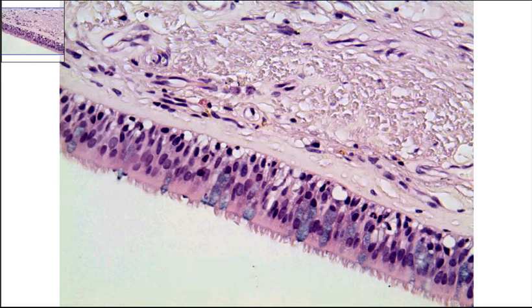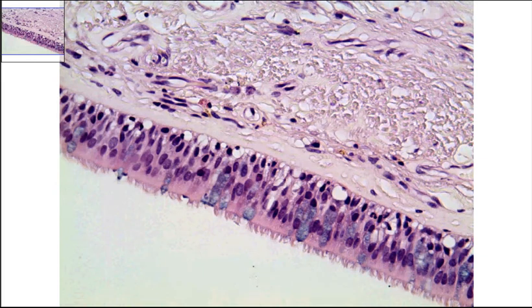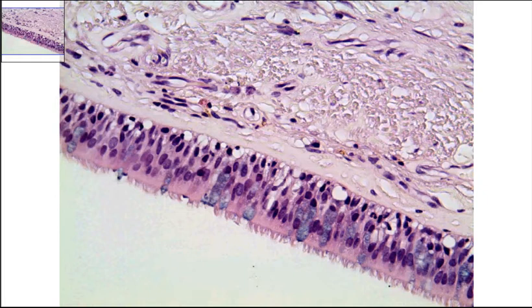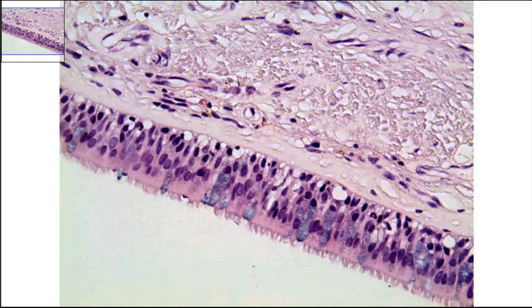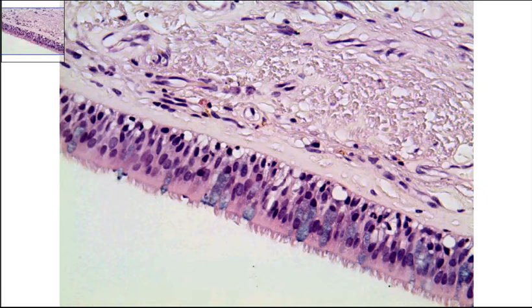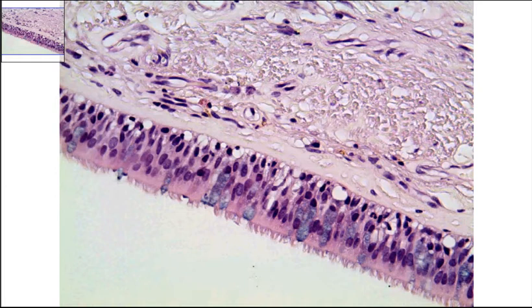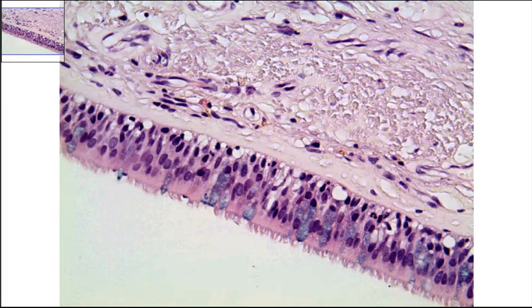This slide is taken from the trachea, or more commonly known as the windpipe. The current magnification is 400x total magnification. What we're looking for is going to be ciliated pseudostratified columnar epithelium with goblet cells.